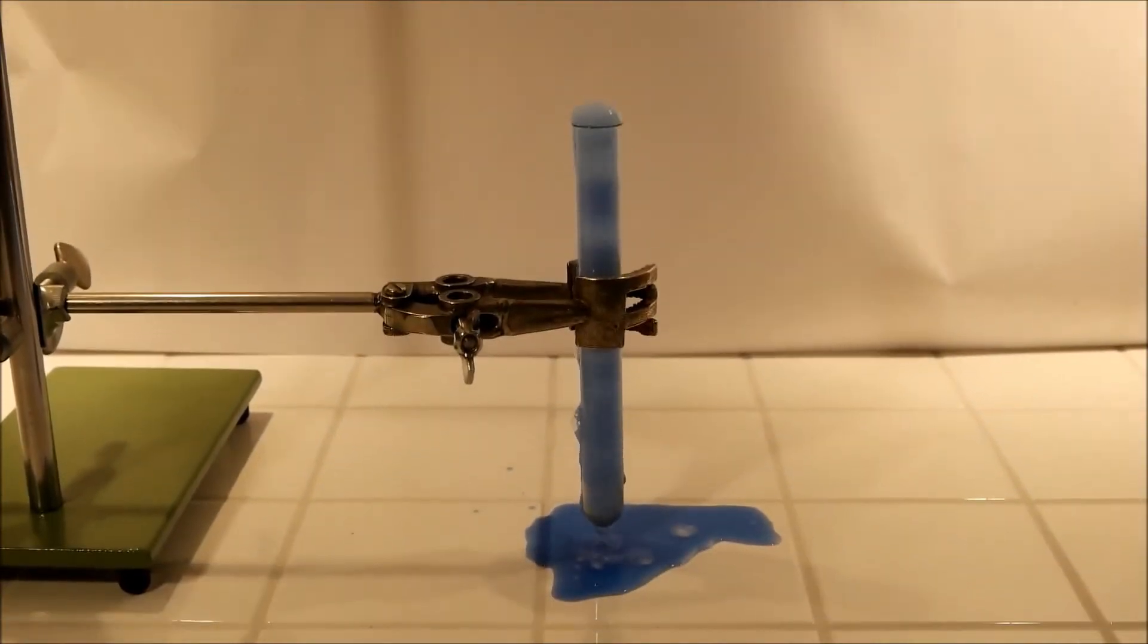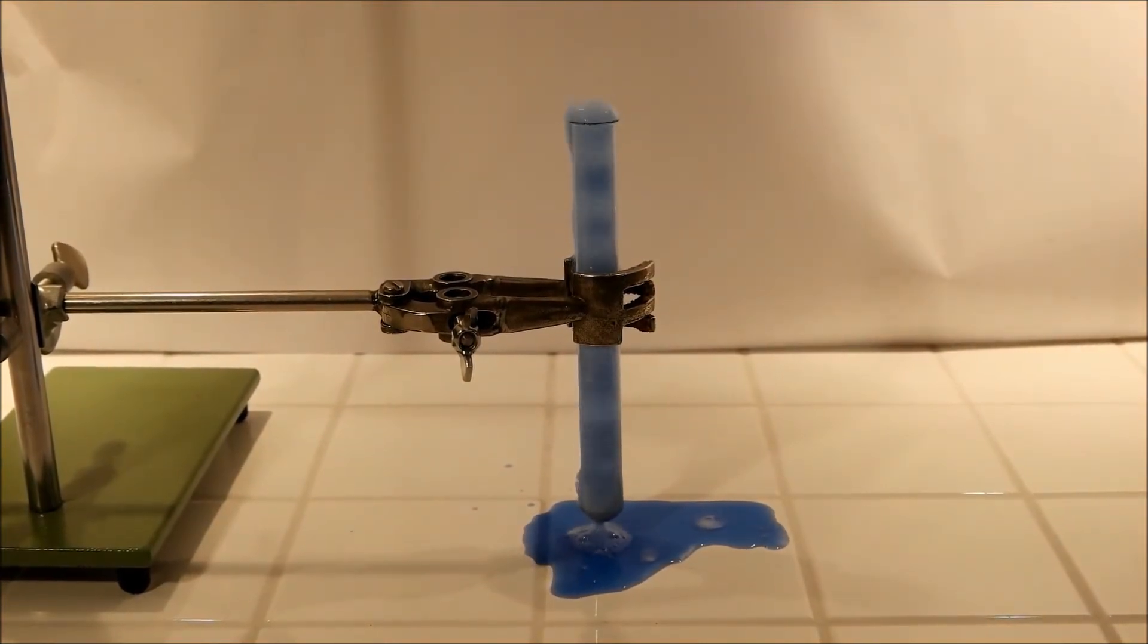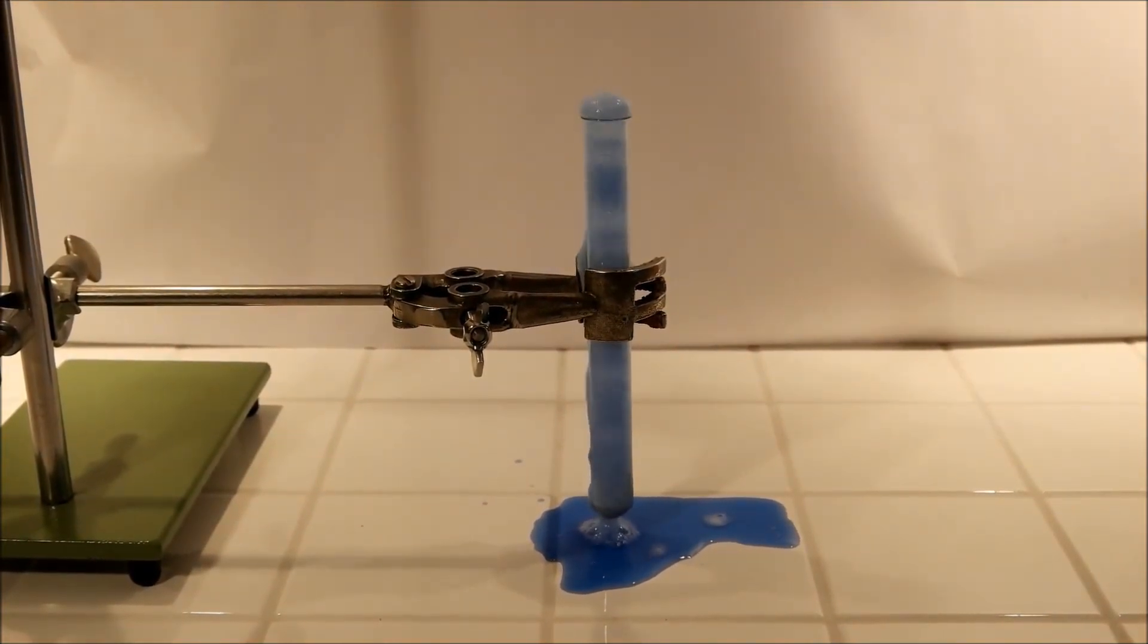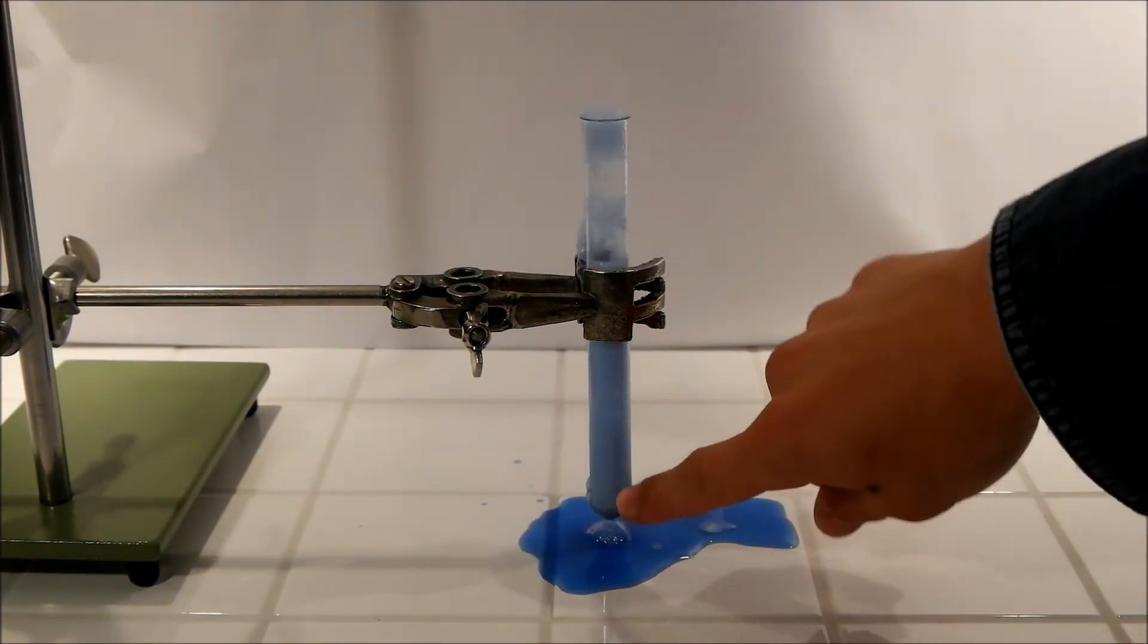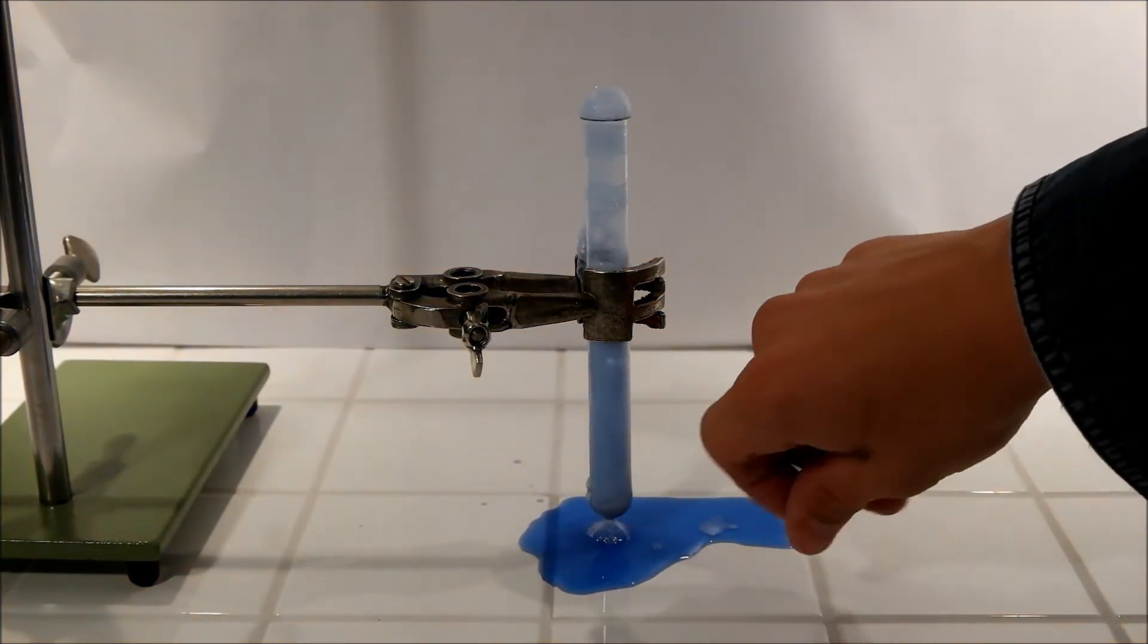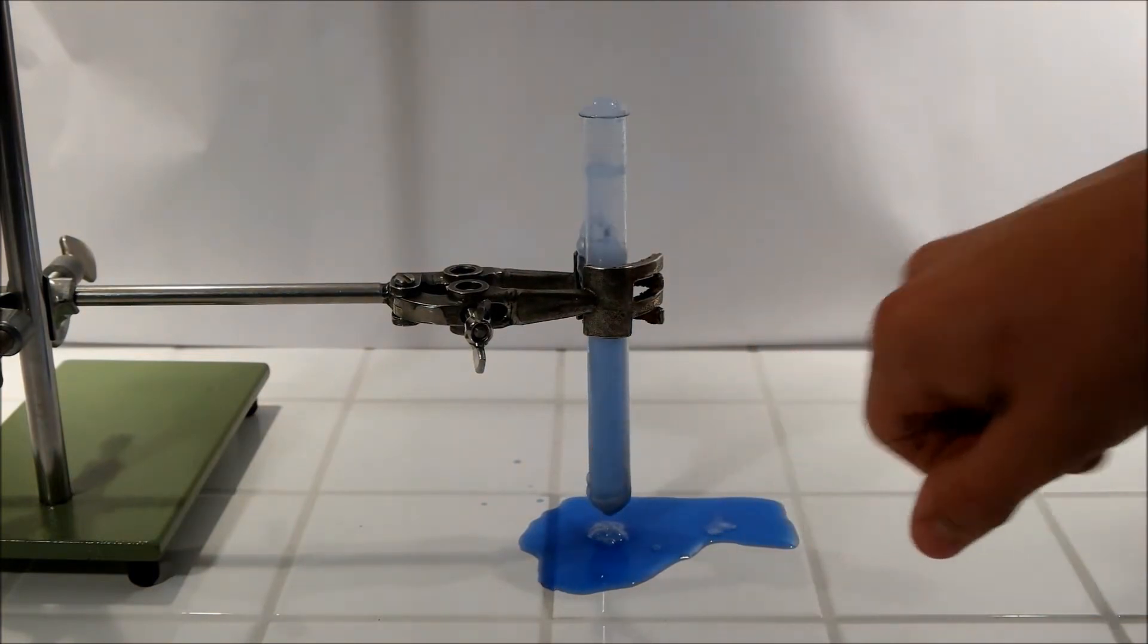Okay yeah that was a bit too much water. Blue means that it's a base, so in this base is calcium hydroxide. I should have added less water. What you can feel is that it's an exothermic reaction so it turns hot.